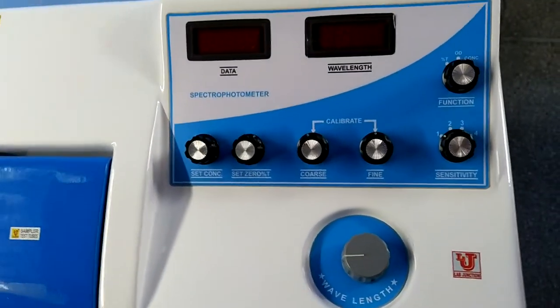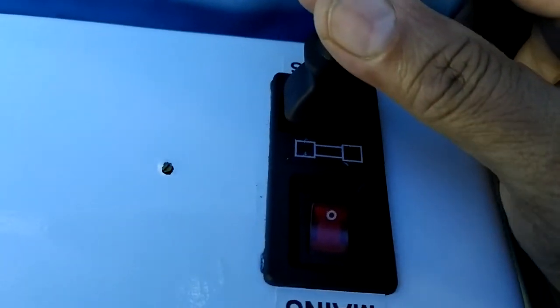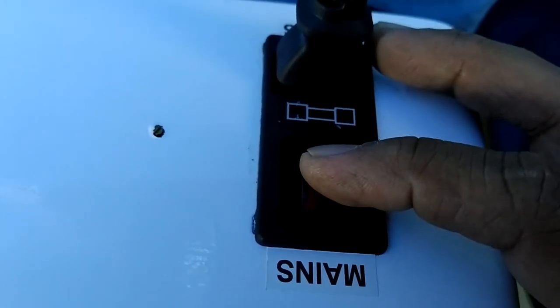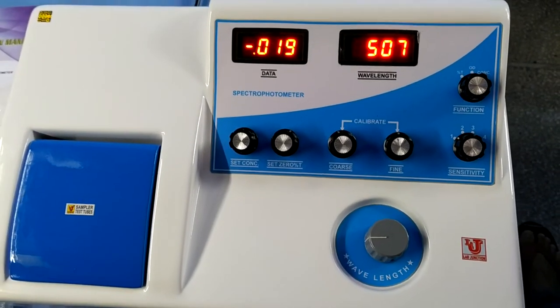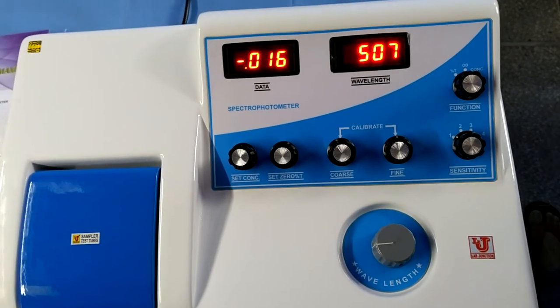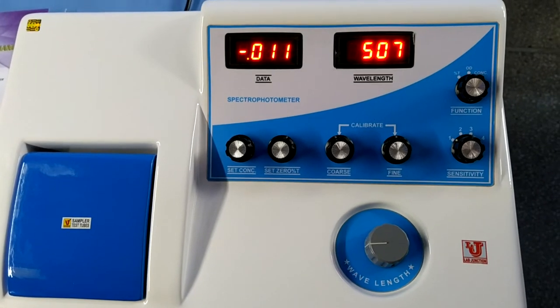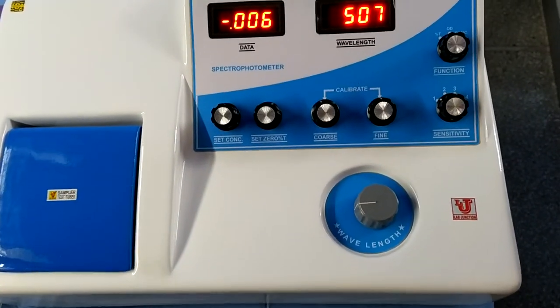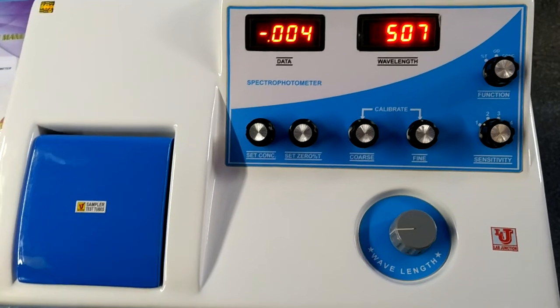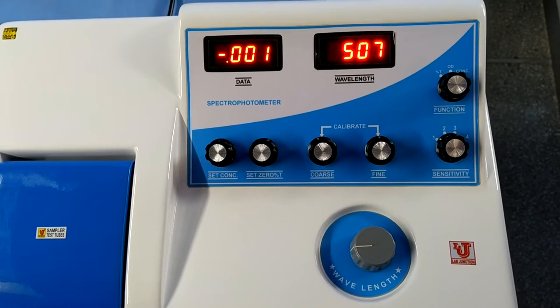In the back controls, there are only two options: one is the power cord facility and one is the switch on/off. Now I am switching on the instrument. With this spectrophotometer, 50,000 types of elements can be detected. But now I am giving you a simple demonstration of cobalt chloride compound. The range of this spectrophotometer is 340nm to 960nm.